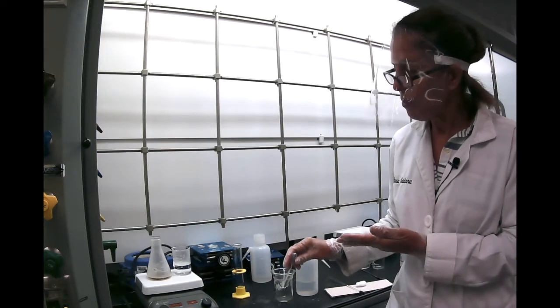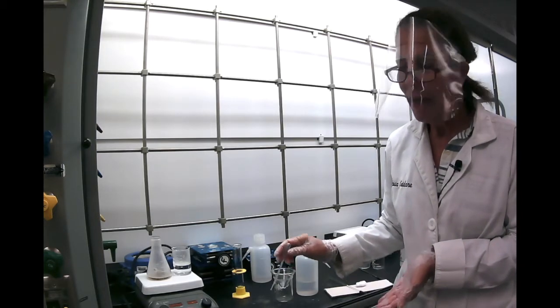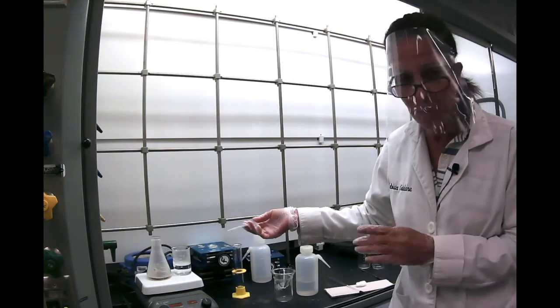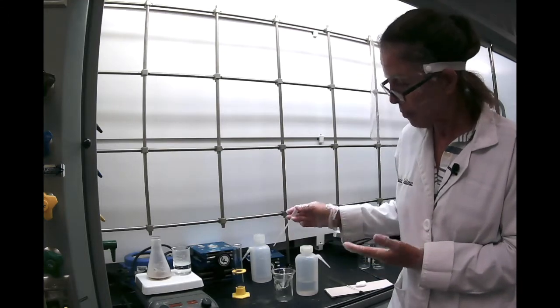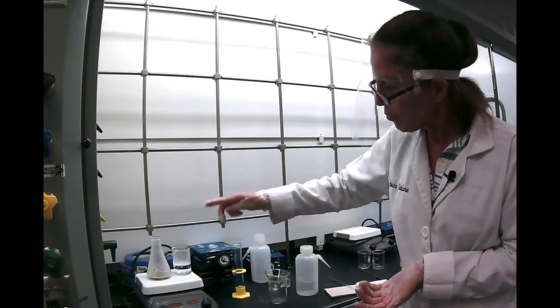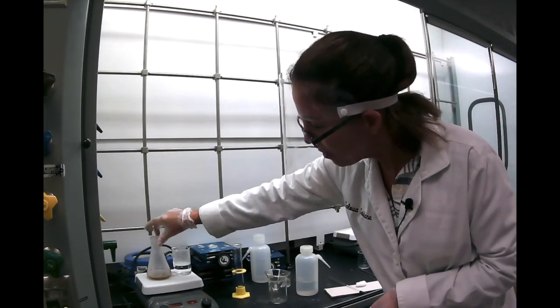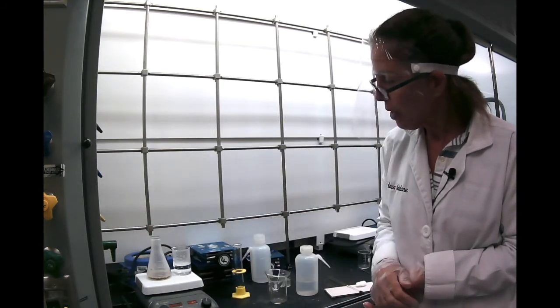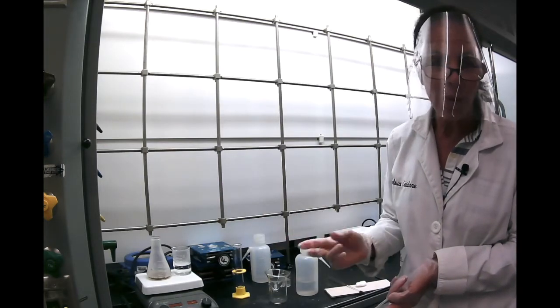So we have some colored impurities in there. And if we had solid, insoluble impurity, we will still get rid of it because we're going to have to do some filtration. So first step, as the procedure says, you wait until it's completely dissolved. It's hot and it dissolves. And then once it's all in, we'll go to the second.